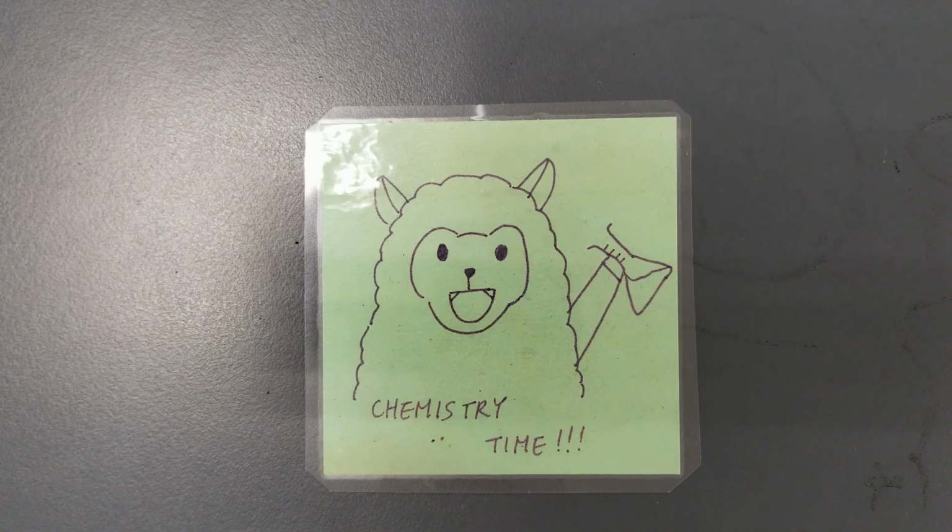Okay guys, so today we're going to have a look at the practical that carries on from the concentration and rate of reaction information that you should have just watched through. So we are going to run through the practical quickly. I will demonstrate what it looks like, how to do it, and then hopefully we should be able to collect some results for you so that next lesson you can plot your graph and do your analysis and your conclusions.